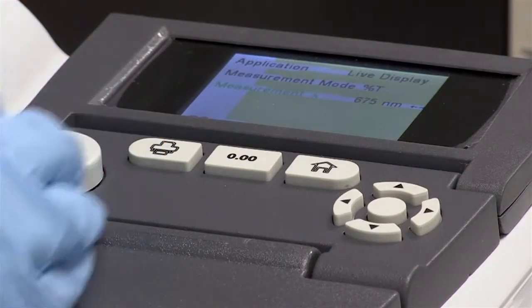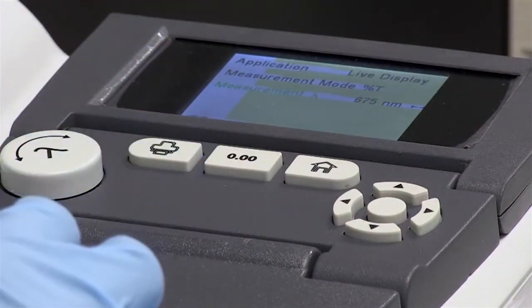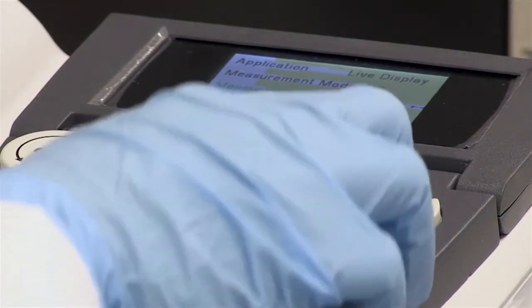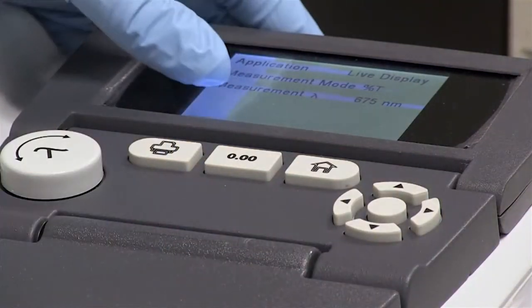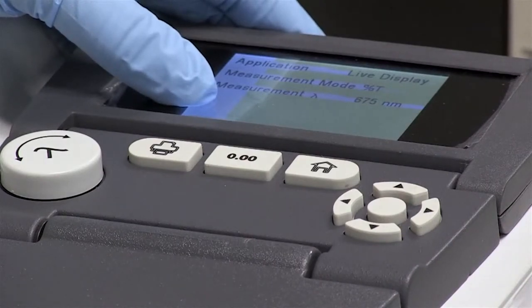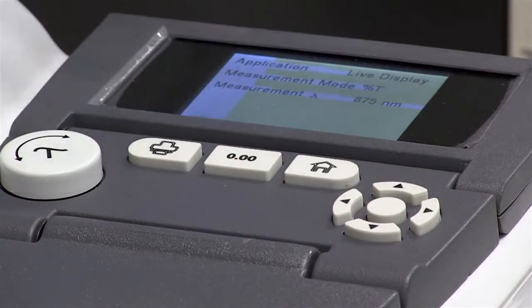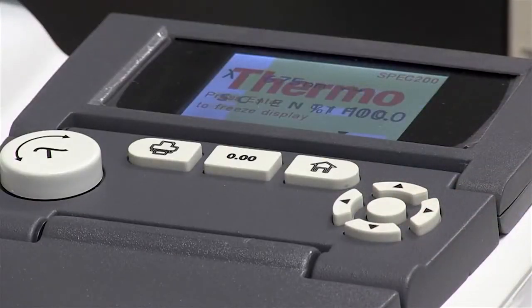That's how you would adjust your wavelength. Now, if you want to actually do your measurement, you have to press the down arrow until it gets to the 'Go' option. Whenever words are highlighted in green, it means that's the option that will execute when you press enter. So if you press enter, it will go and start the measurement.